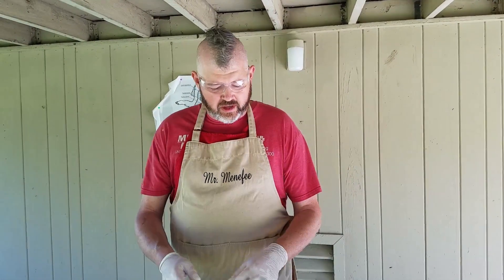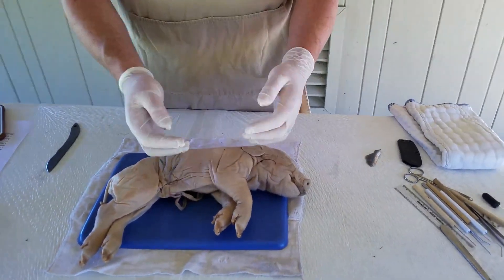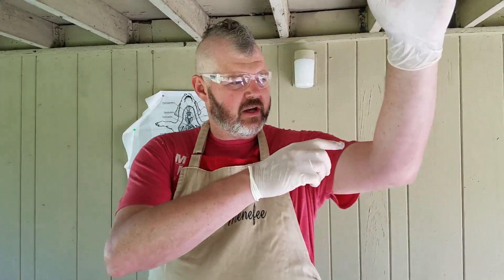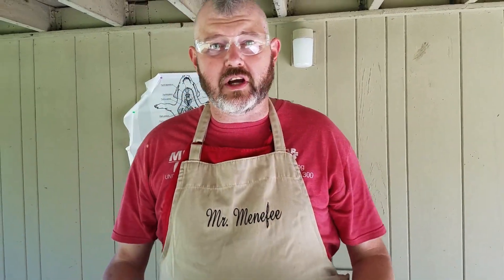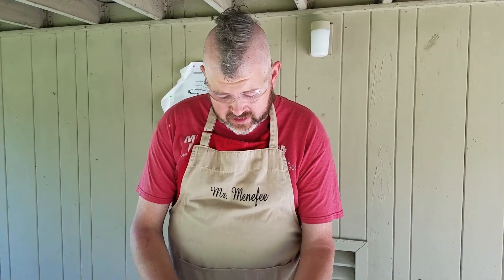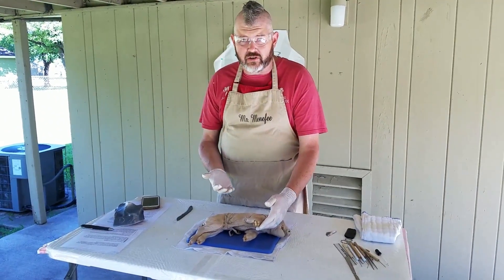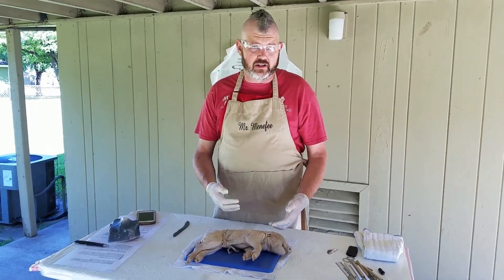In a human, we'd be looking for track marks generally in the arms and elbows. For humans: here, here, here, here, the webbings of toes — any place where there's an artery and vein. We'd be doing the same thing with a pig. The pig has not been using intravenous drugs, so we're not super concerned about that. So what's the next step?